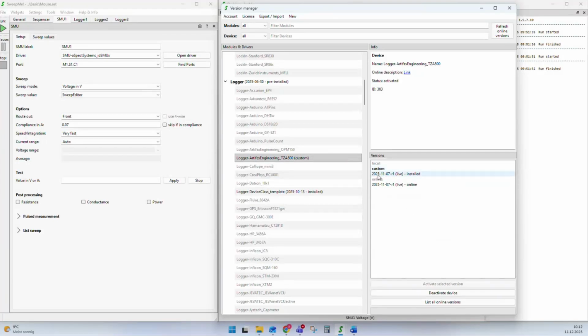If we have created a custom version, you can see that we now have locally two different versions installed, custom and the version from our server. The server version cannot be modified. This shall ensure that you can have a well-defined setup at your computer. But of course, you can create these custom versions, and these custom versions can be opened in an editor.